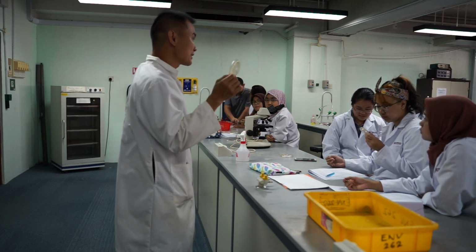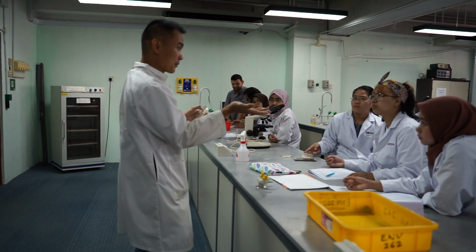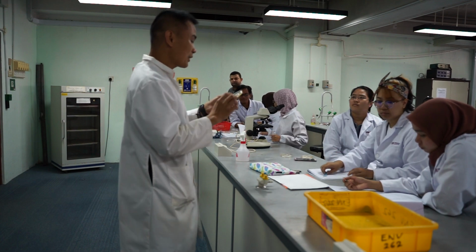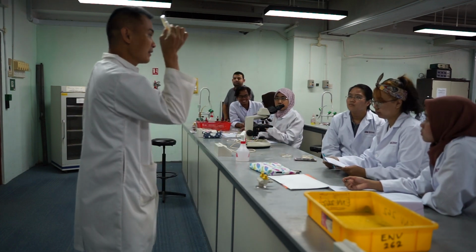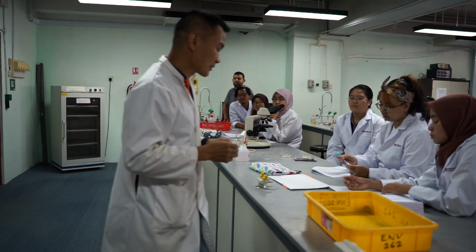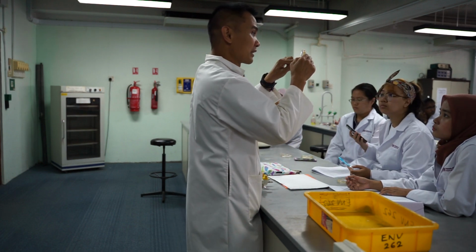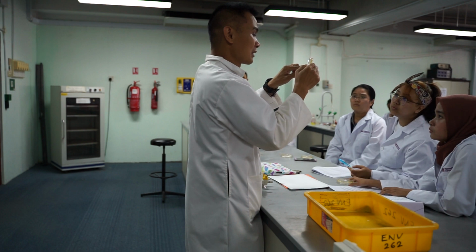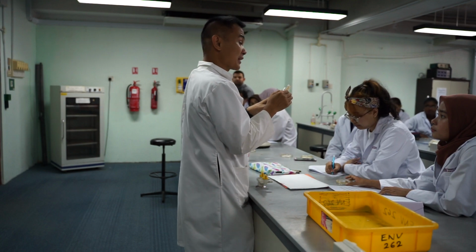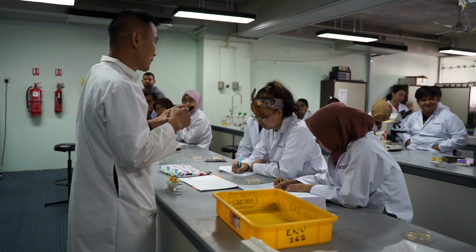So instead of doing serial dilution, what you should do last week was actually to concentrate it. So you can use filter and then concentrate it more, but we didn't do it in our lab. Okay? So once it grows, you want to know what are the bacteria that you managed to get. Okay? So first, if you look at your samples, because yours is not very concentrated, can you see single colony? Like one round. Okay. So maybe there is one colony from there, assuming it's actually one colony, but sometimes they are too close to each other and you cannot split them.